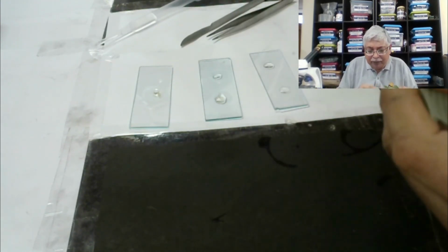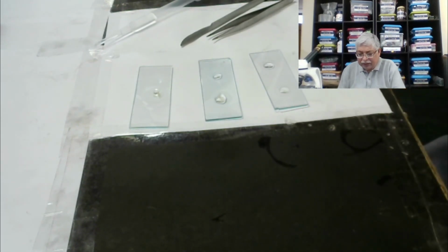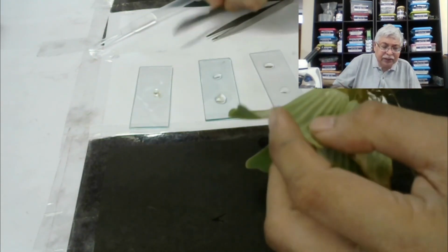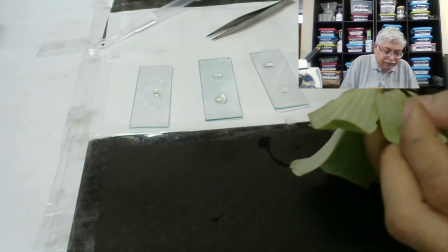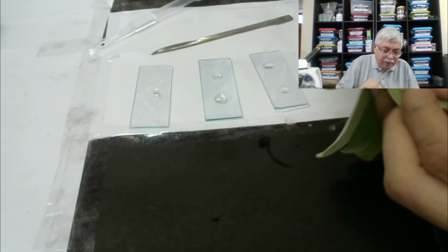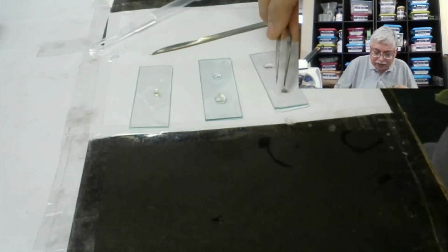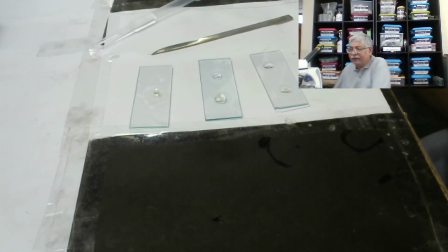It seems to be quite big. I can see the snail shell right here. And in the third one, we got some other jelly-like substance. So from here we scrape the thing. Keep it here. So we got 3 slides with different setups. Let's see what we can see.